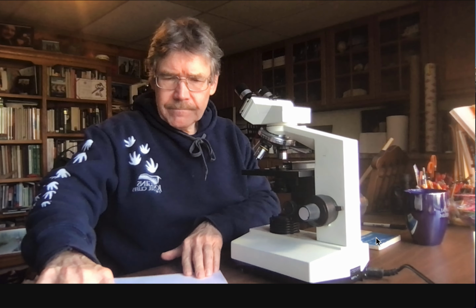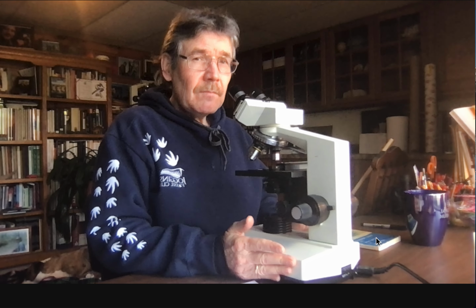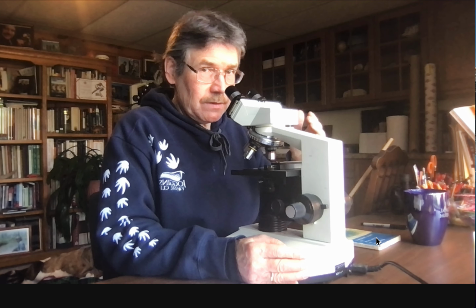Okay. Now I was talking about posture before. I've picked a pretty good chair right now. It's not perfect, and it's not adjustable either. When you look through a microscope, you like to try to stay as straight as possible. In the Zoo Lab, the botany lab, the cell biology lab, all throughout Mayhem, the chairs are adjustable. You want to adjust it so that when you're sitting with your back straight, just like this, that's where the eyepieces are. You can see it's not where I want it to be right now.